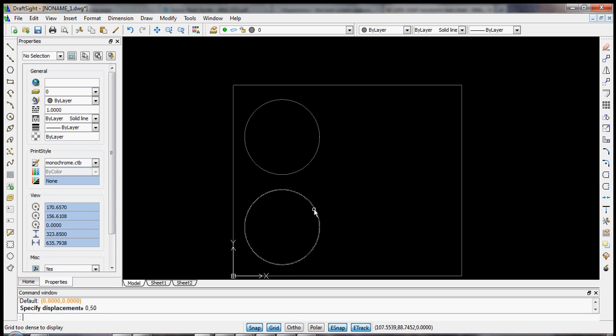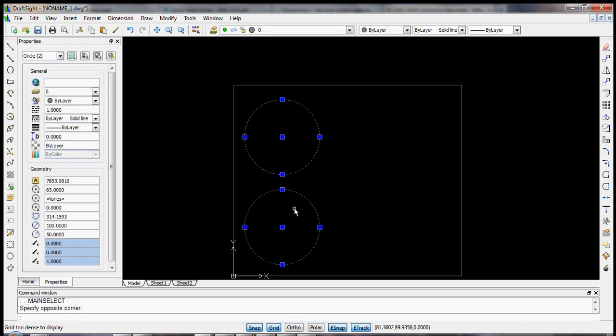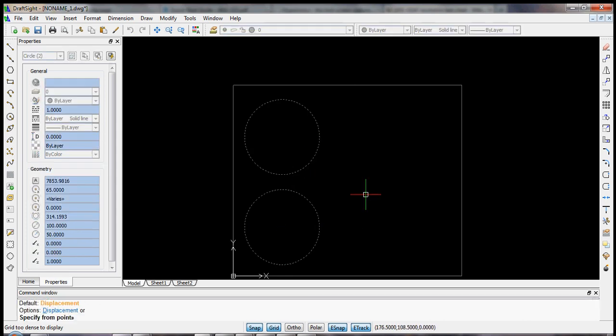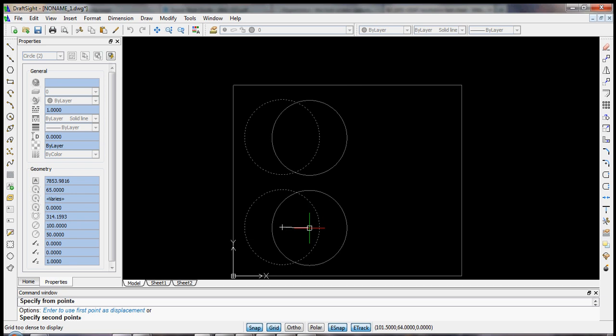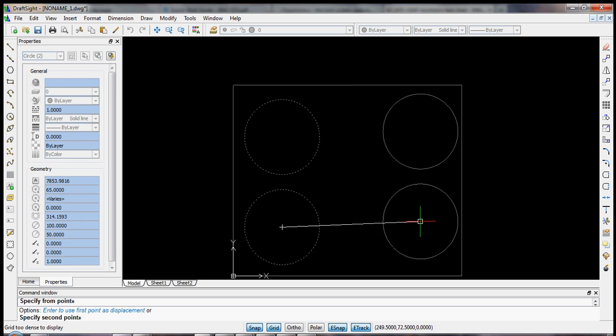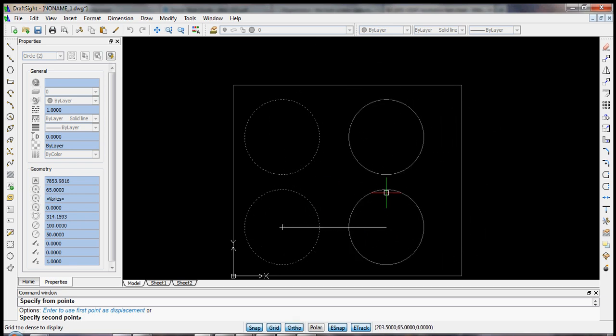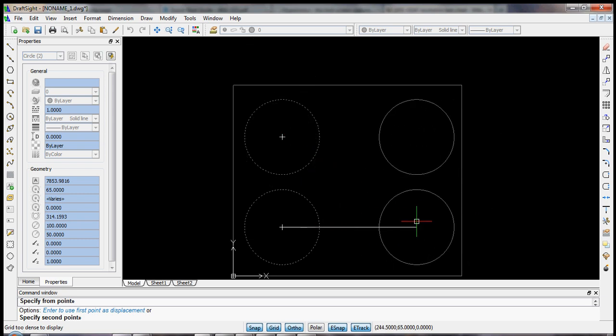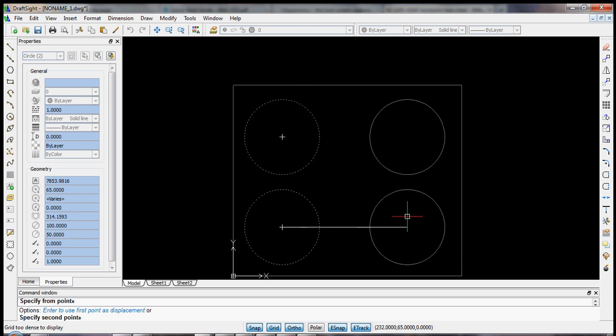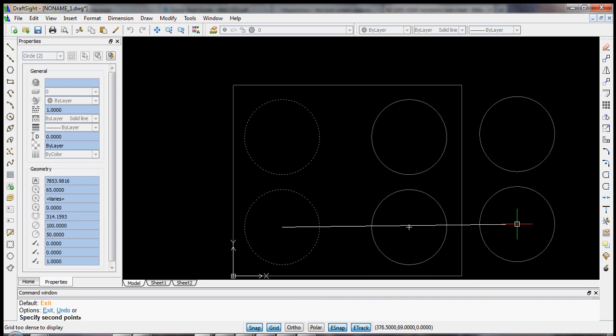Now the next thing to do is to figure out how else we should copy these. Let's select them both, copy, and we want to move them now horizontally. So here I've clicked on the center point of the bottom one. You see I'm moving both together. And if I hit shift, I've now constrained the movement to be horizontal or vertical. And let's just give an approximate distance right now. We'll clean it up a little bit later. Let's say about here. So left click, and we've made our copy.